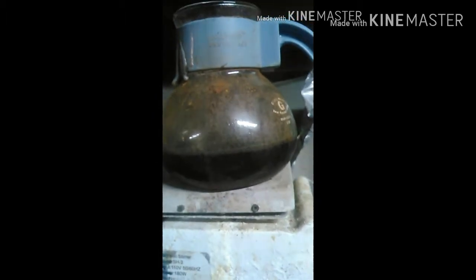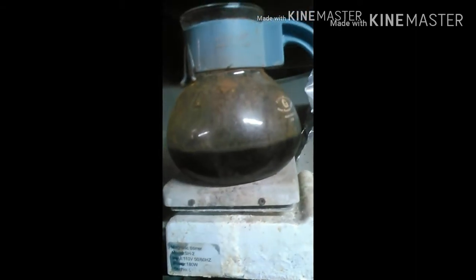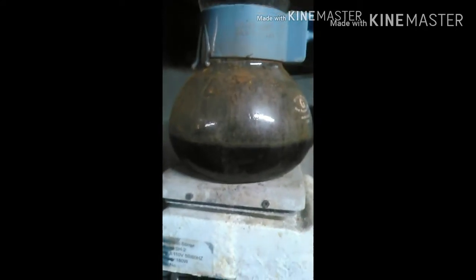You keep doing this until you don't get much of a reaction. Now, if your temperature is high, every time you add hydrogen peroxide — whether there's metals to be dissolved or not — it will have a reaction. I forget the exact temperature, but it's right before boiling. You can see there's a reaction going in there; that's about how much boiling you want, a little hotter than this. Keep doing your acid and hydrogen peroxide until you get all your metals dissolved, then let this cool and filter it. I'll be back at that point.